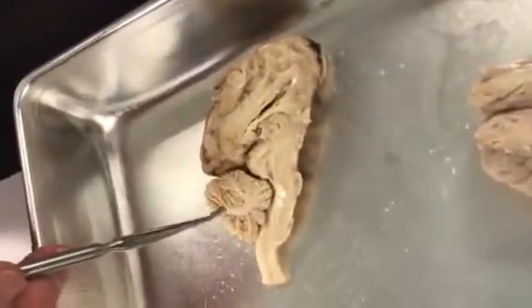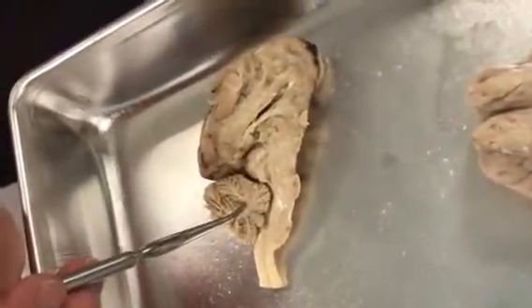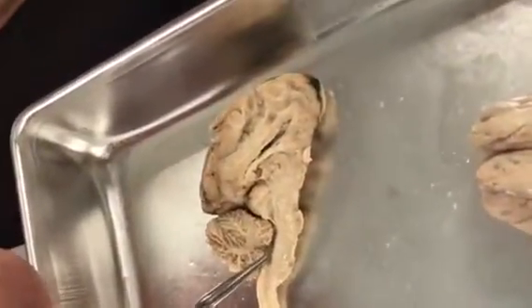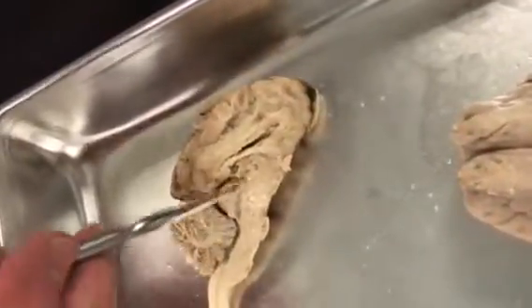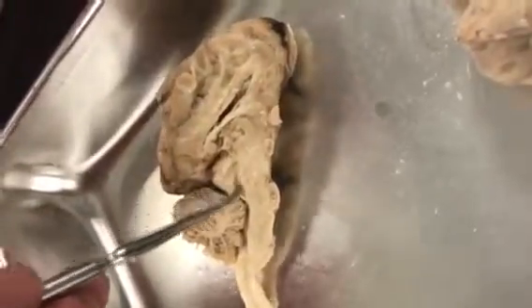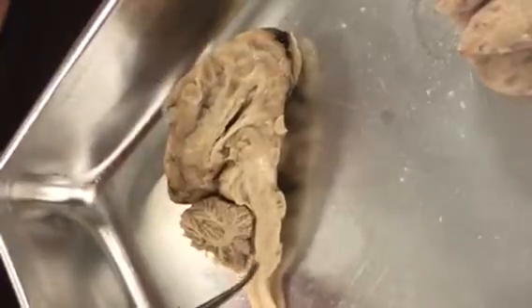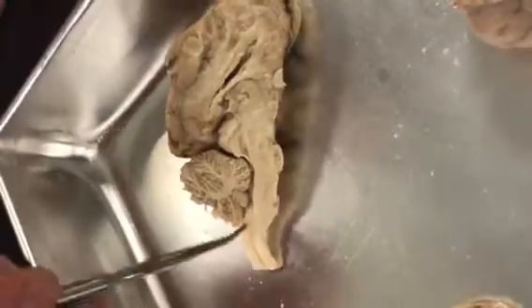Now, this is the cerebellum, and the white matter in here? Arbor vitae. Now, where the cerebellum connects to the pons? Fourth ventricle. Third is here, so here's the fourth ventricle. Connecting the third and fourth ventricle is this indentation that's coming through the midbrain. That's called the cerebral aqueduct. So that connects the third to the fourth ventricle. After the fourth ventricle, cerebrospinal fluid then flows down into the spinal cord through the central canal.